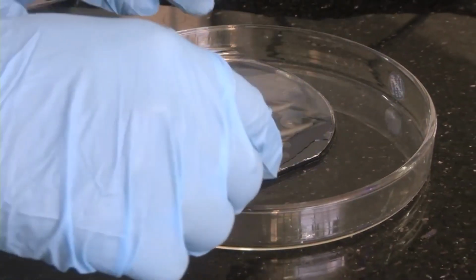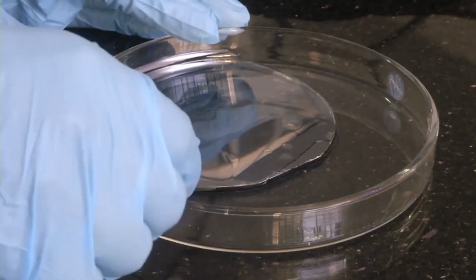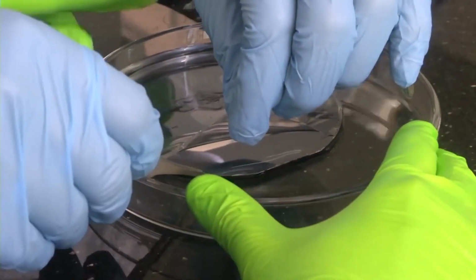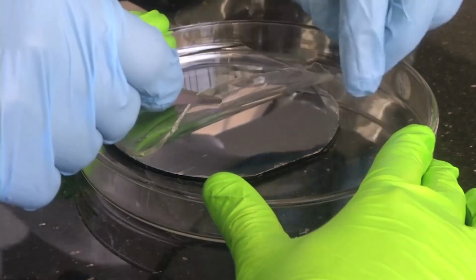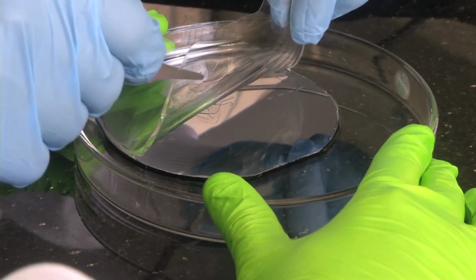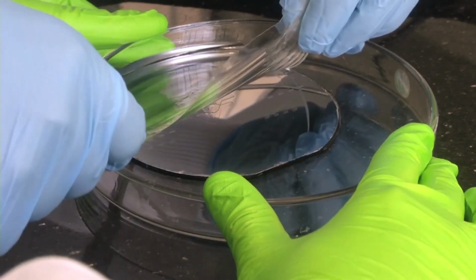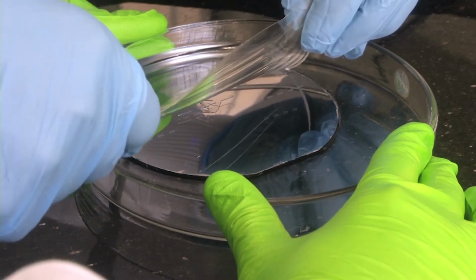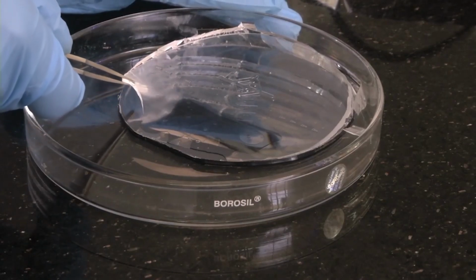We have to be very careful while doing this. So slowly we are taking it out. Then somebody should parallelly hold the dish, because it is glass, it should not slip, and then slowly take it out. So now we have cut across the PDMS membrane around the mold, and we are now taking it out, as you can see.